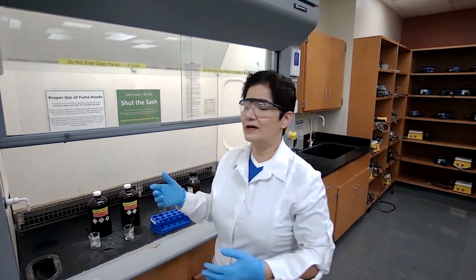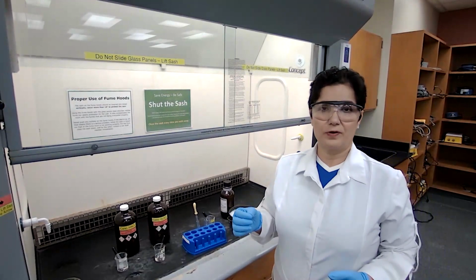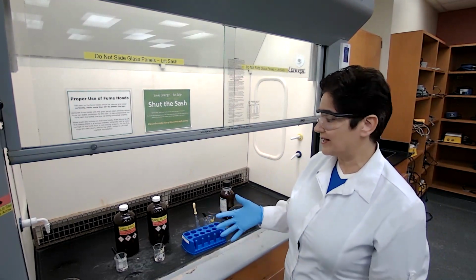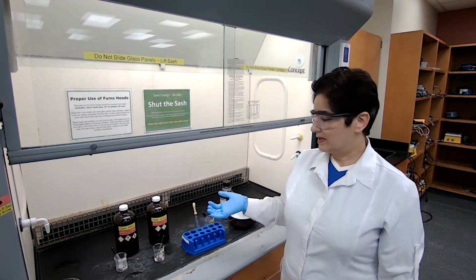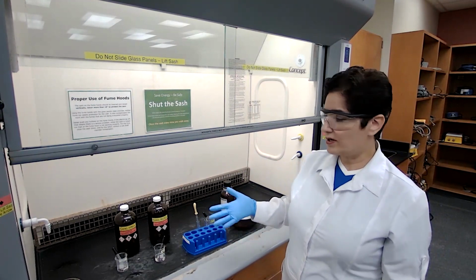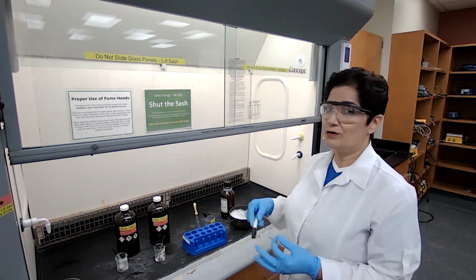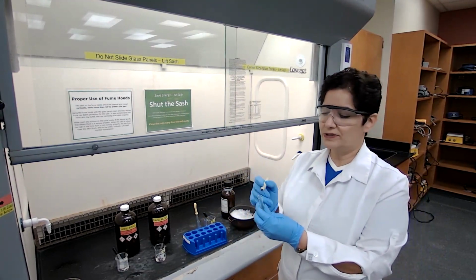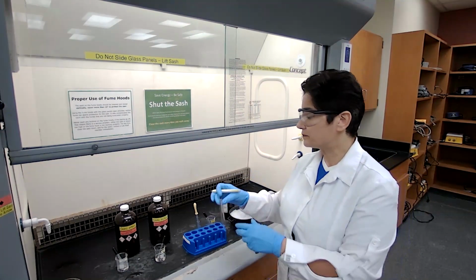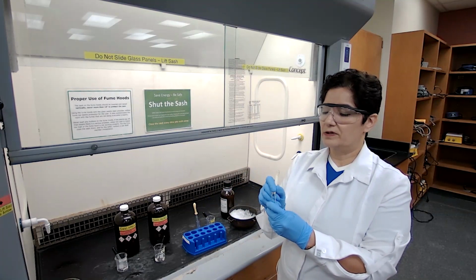I am using a very low volume or low quantity of the chemicals, for obvious reasons: we are dealing with concentrated nitric acid and concentrated sulfuric acid. I don't want to use 5-10 milliliters of these compounds to make the point that we can get meta or ortho-para. So it's very close to micro scale. Going to label two test tubes, A and B. You could use labeling tape or a marker to label your test tubes A and B.